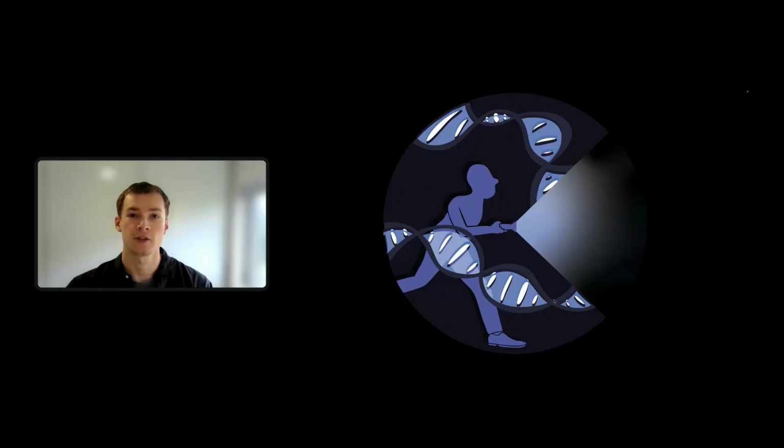Thank you for sticking to the end of this tutorial. I hope it's now clarified how the use of these large-scale human genetic data sets can supplement omics data and really be an important part of that bioinformatic toolkit. For us, it's the scale of Synteny that makes the most difference. And the more genes and the more phenotypes you analyze, the greater your potential insight into your existing data you can unlock.